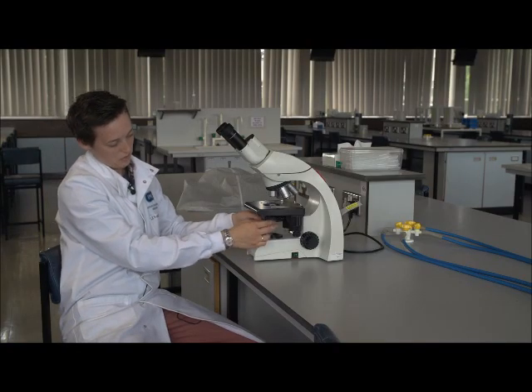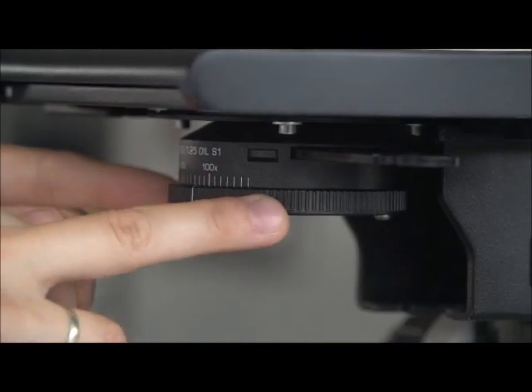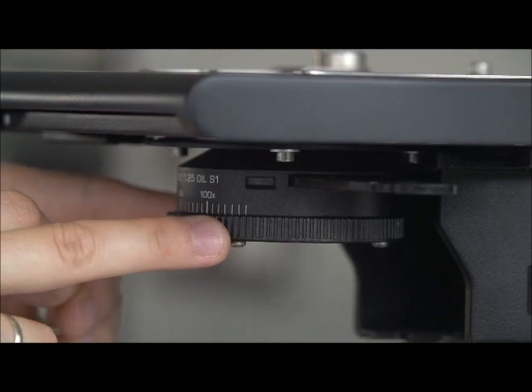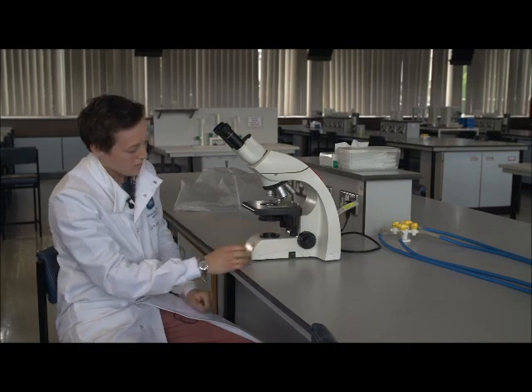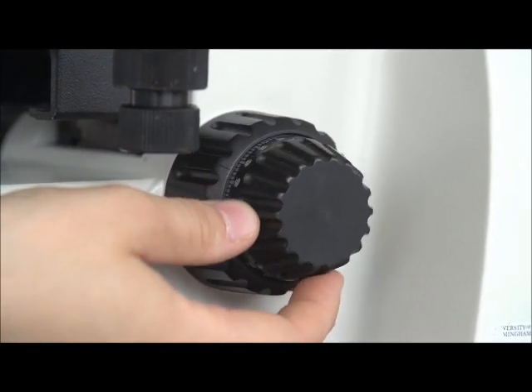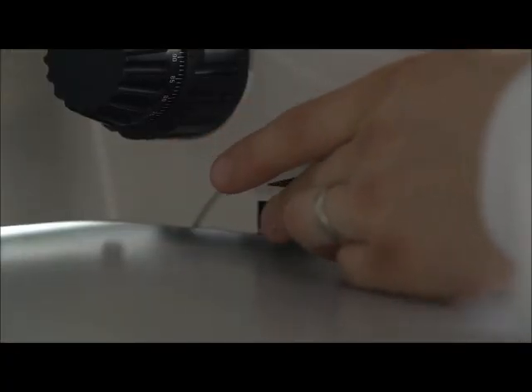Underneath that we have the condenser, and in the condenser is a diaphragm, an iris diaphragm, and this can be opened or closed and has markers on it specifically where it should be for the objective in use. Below that is the lamp housing where the LED light source is kept. On the right hand side here we have the on-off switch. We also have the coarse and the fine focus. And on the left side we have the controller for the level of light.